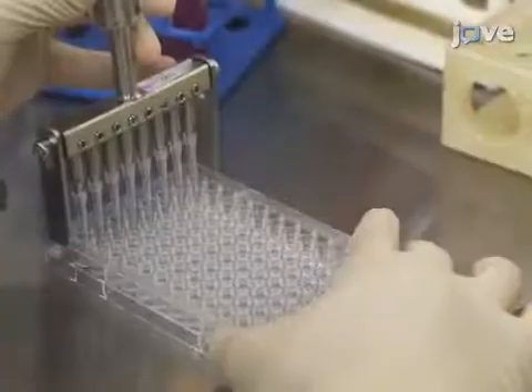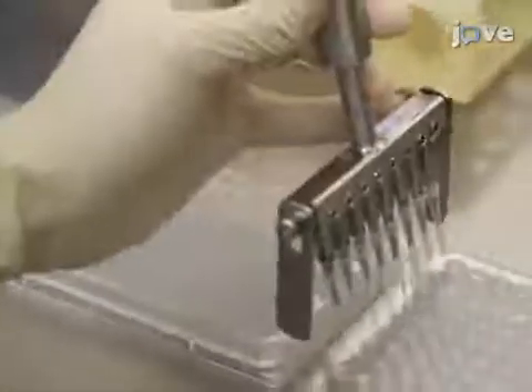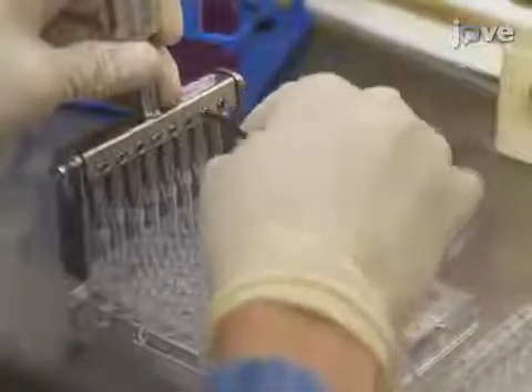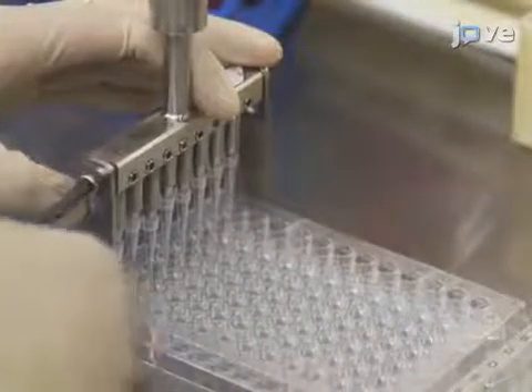Next, fit the adjustable guiding bar on different brands of 96-well culture plates and ensure that the wounding area is in a fixed position. Fix the adjustable wounding pin by tightening the hex screw. Fix the guiding bar in position by tightening the hex socket headcaps on both ends.